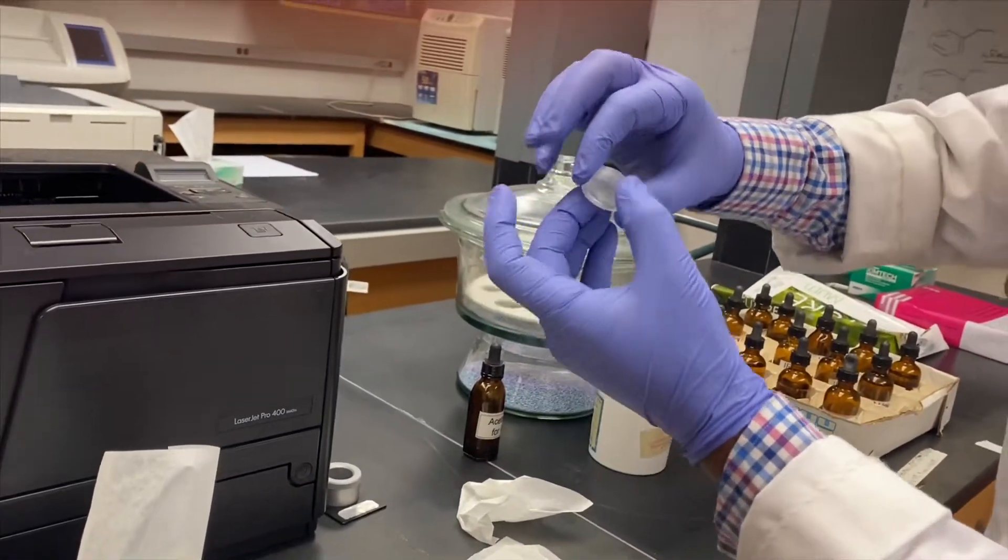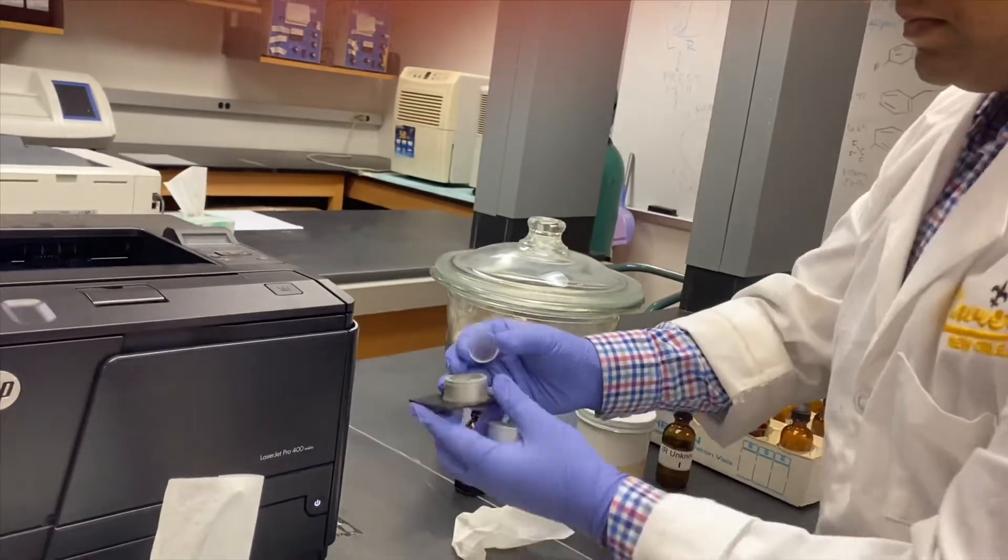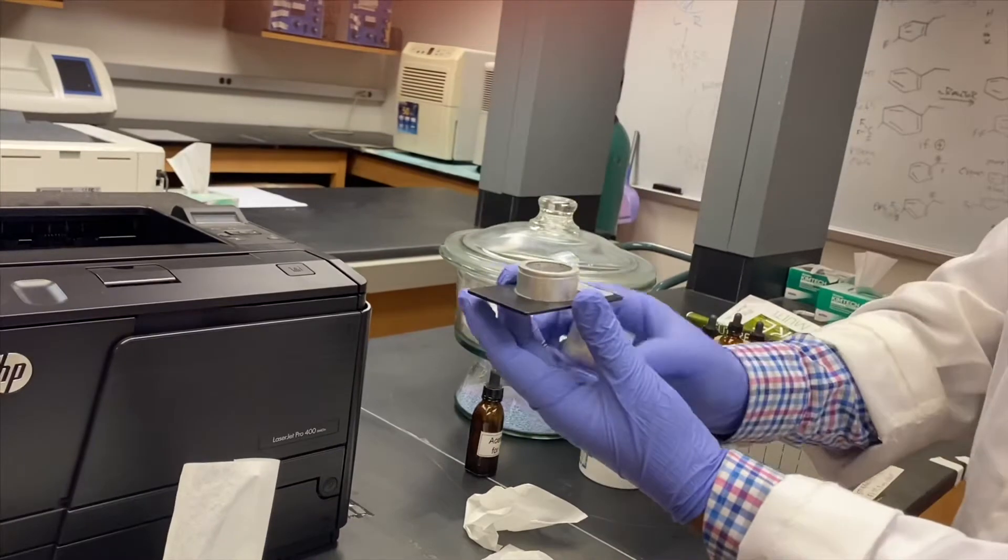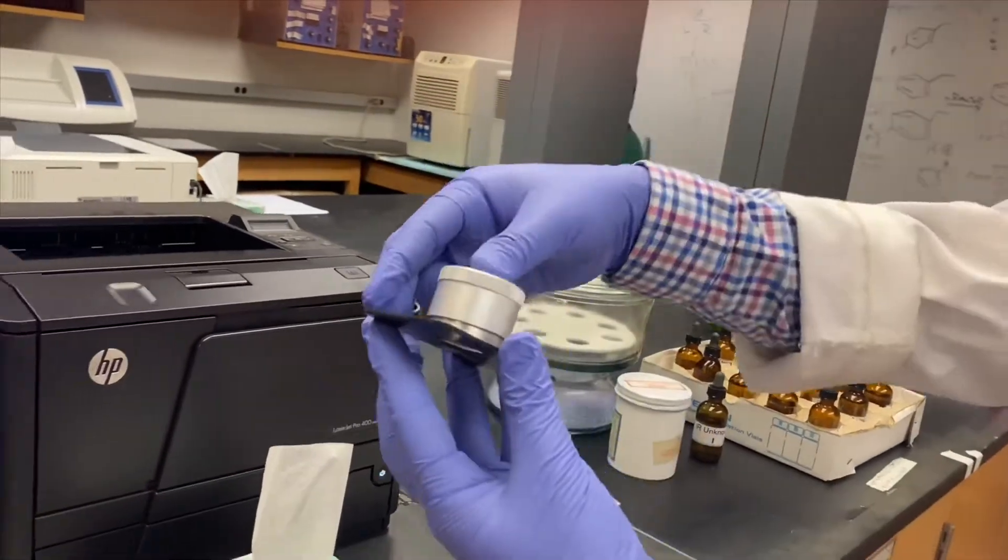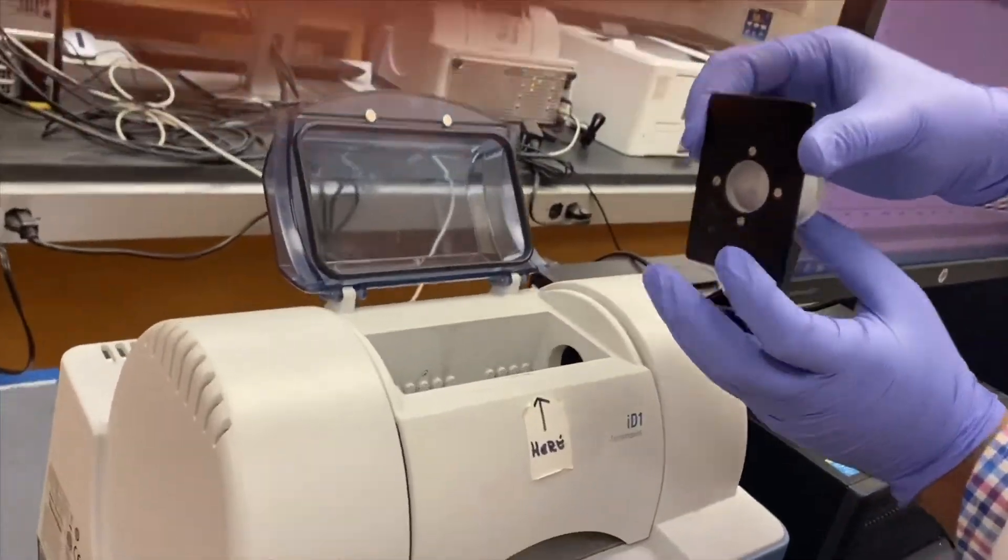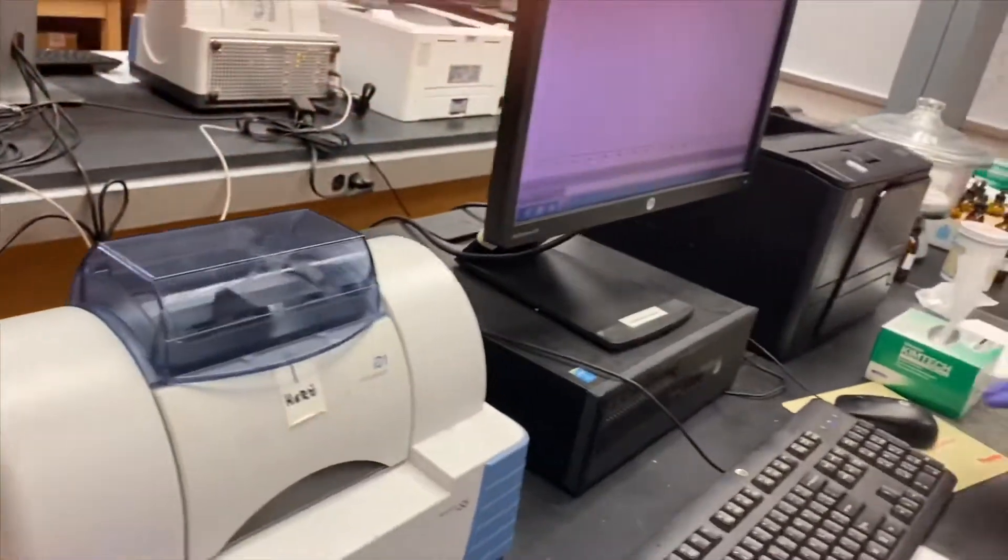Pick up both plates together and place them in the IR sample holder so it lies flat. Top it with the sample holder cap and place this in the IR spectrometer parallelly in the chamber.